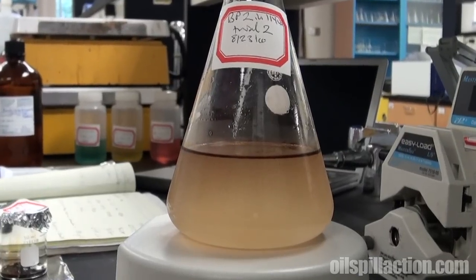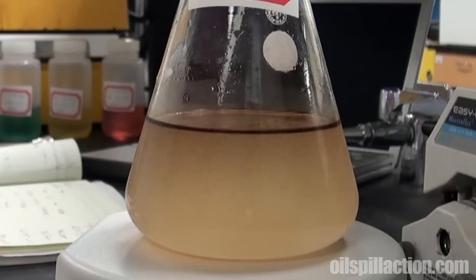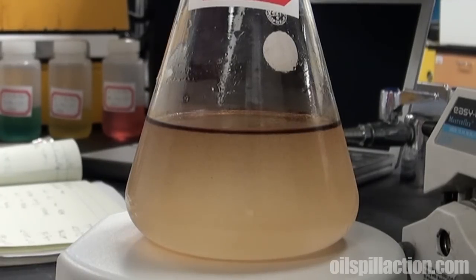Now this time when we stop the stirrer, when we have a mixture of dispersant and crude oil, instead of the crude oil going right back to the surface, this time, much of it stays in the water itself.